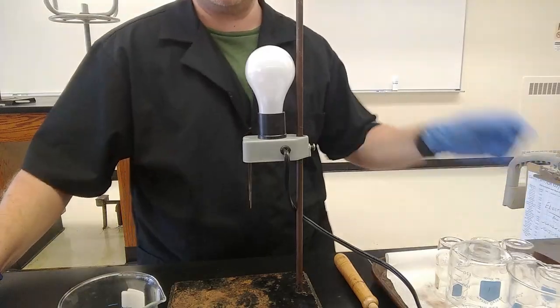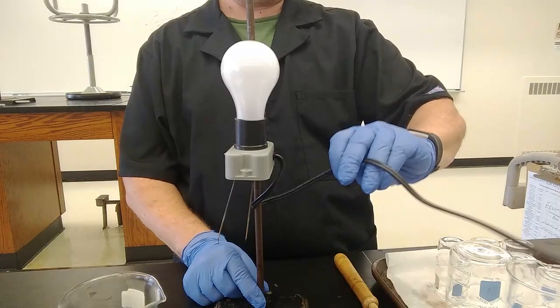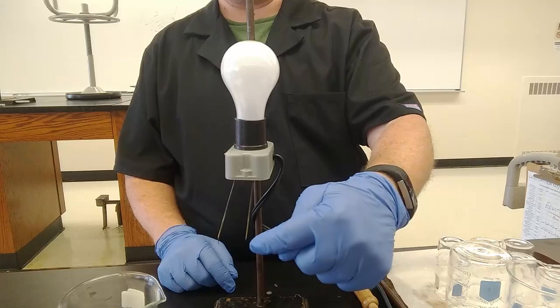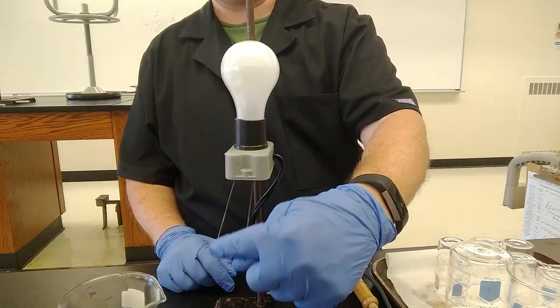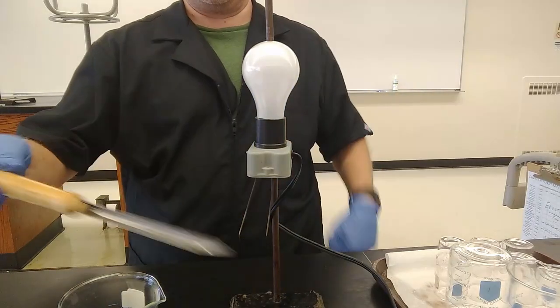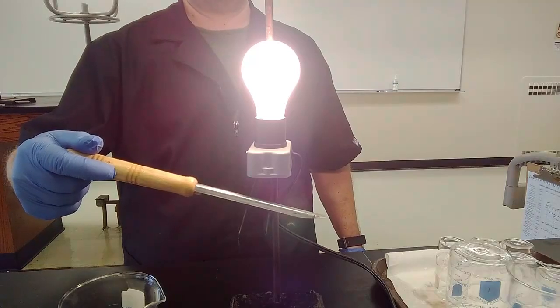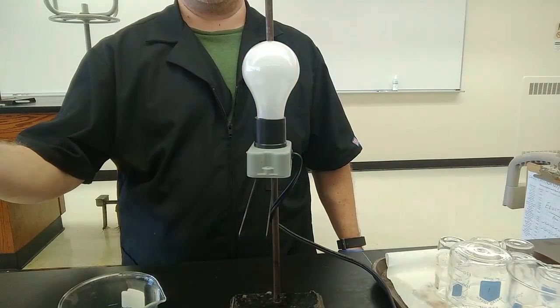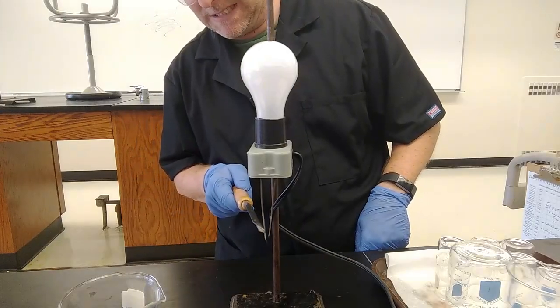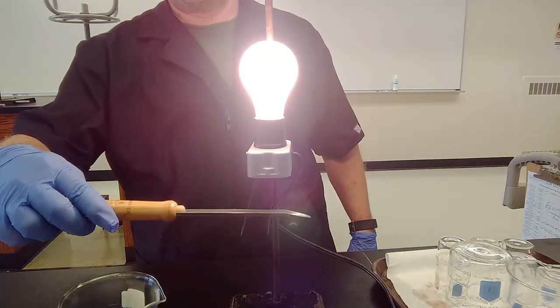So we have a conductivity tester here, which is just a wire plugged into the outlet over there. One wire down, break, no connecting the wire, other wire up, light bulb. All right, so if we connect the two wires electrically, say with a piece of metal, light bulb on, nice and bright. No connector. I could just connect the two wires together by bending them. Same thing, super bright, but same thing, all right?